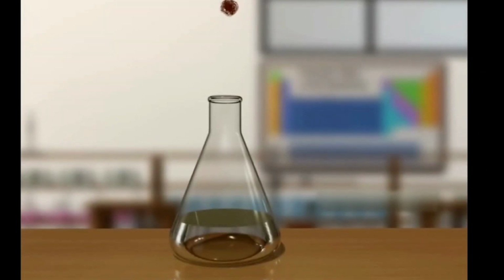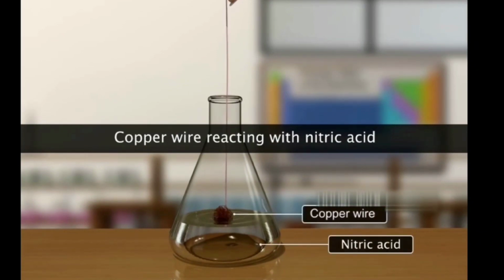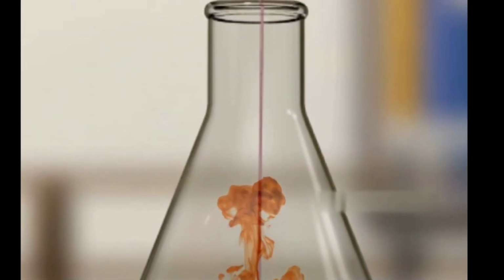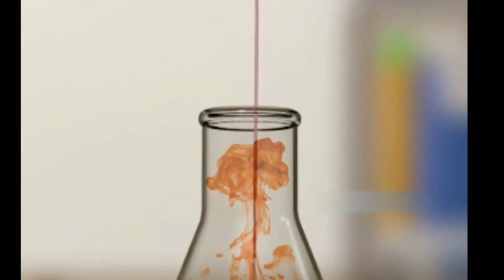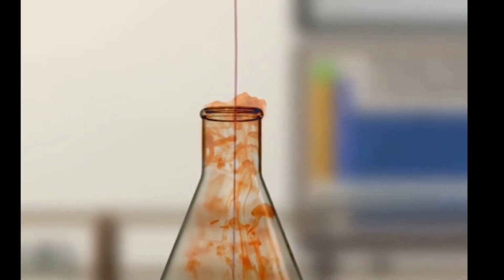Watch this experiment. You can see copper reacting vigorously with nitric acid. It forms an irritating brown gas. It is poisonous nitrogen dioxide. Experiments of this type must be conducted only in a fume cupboard.